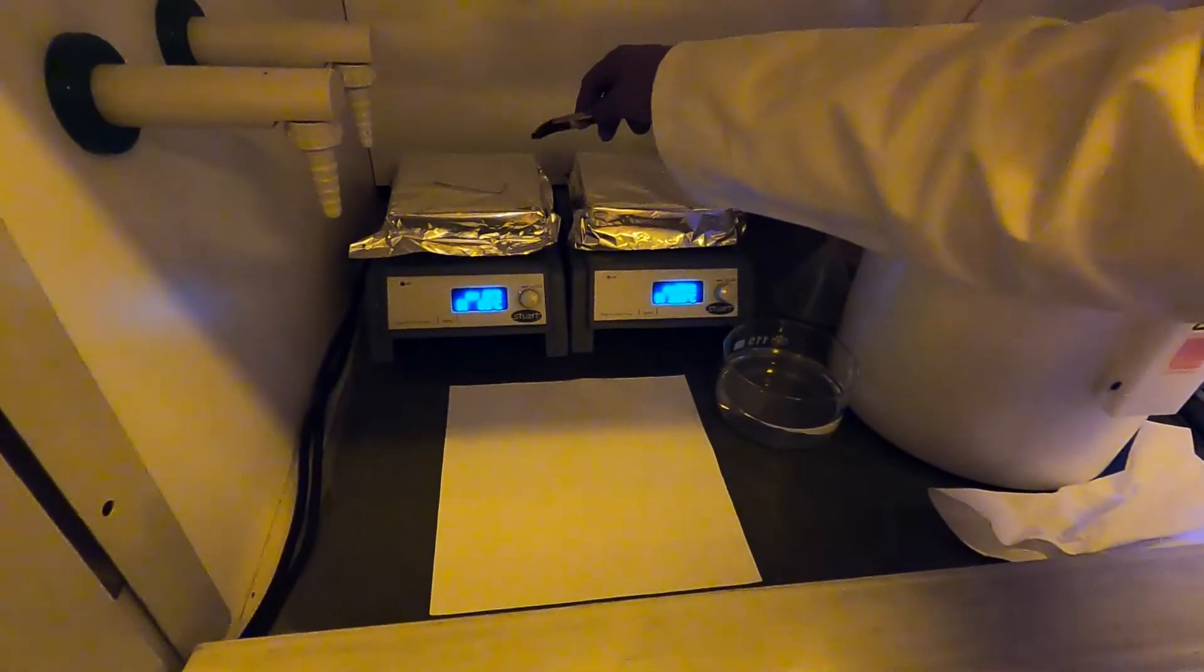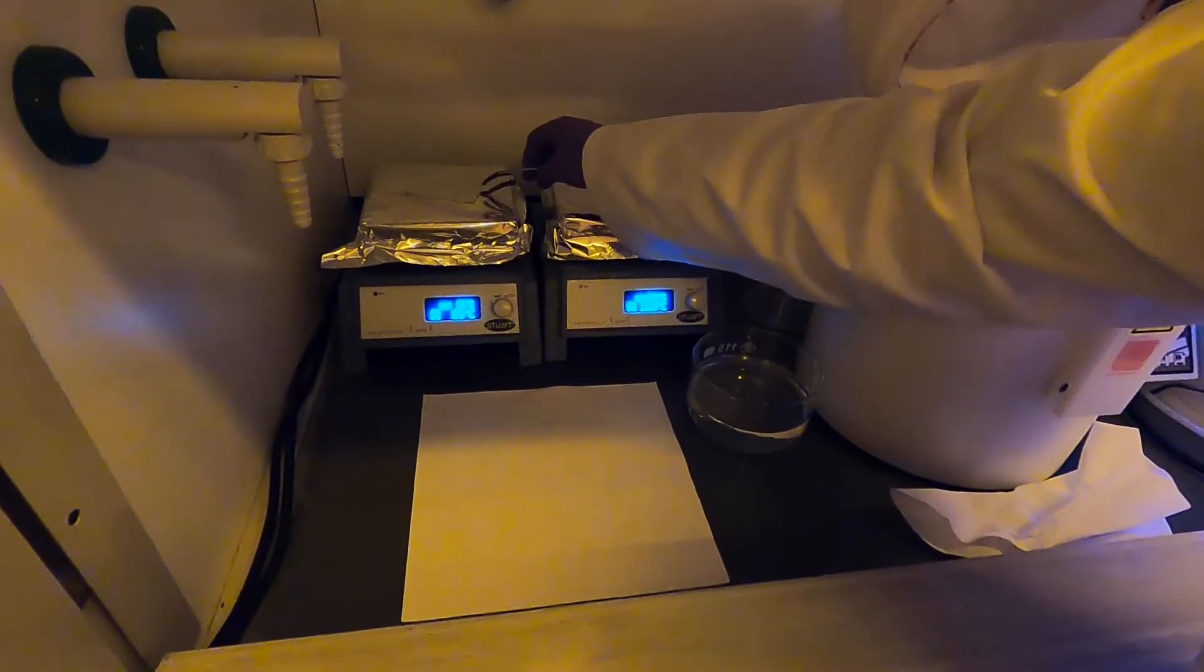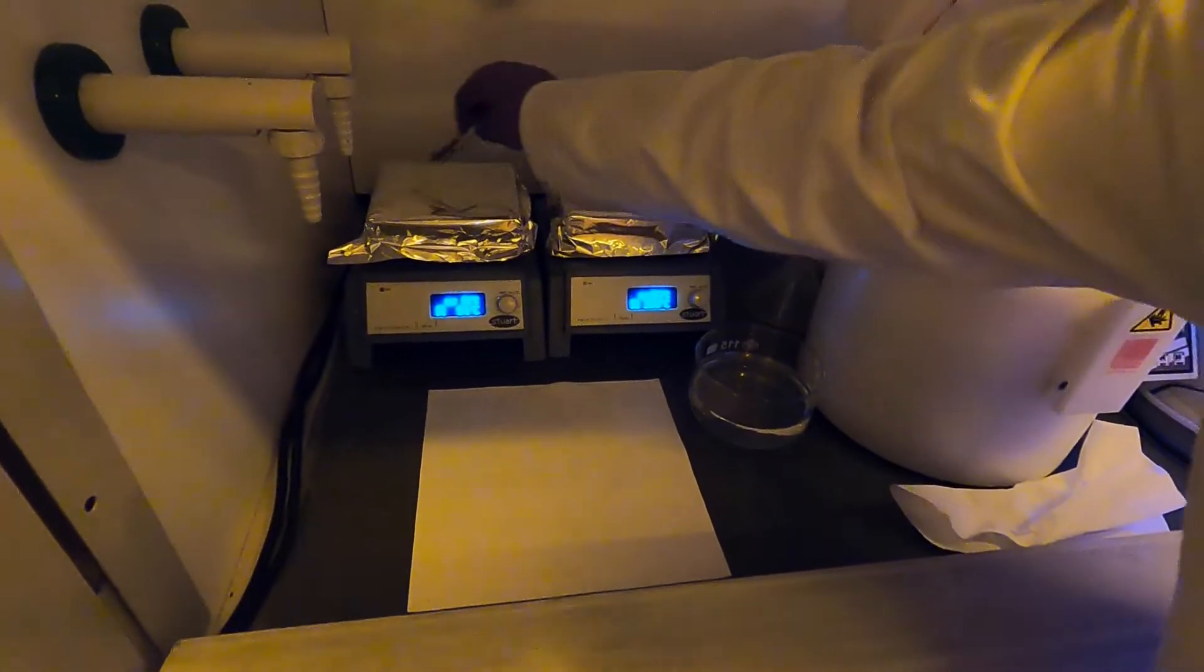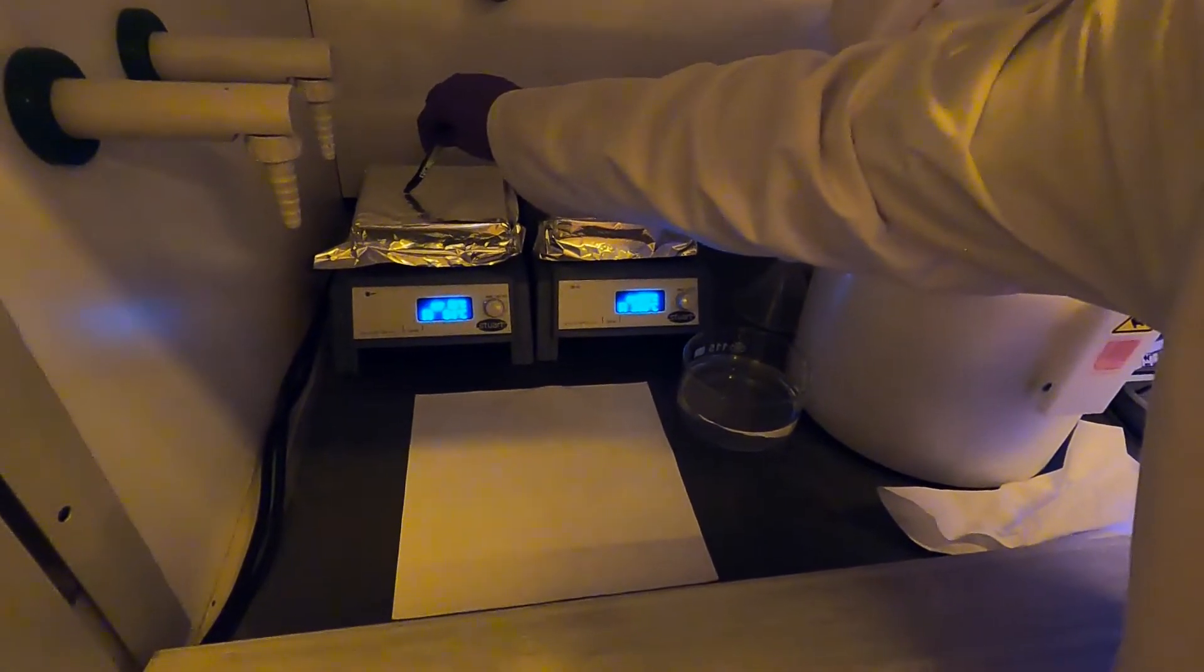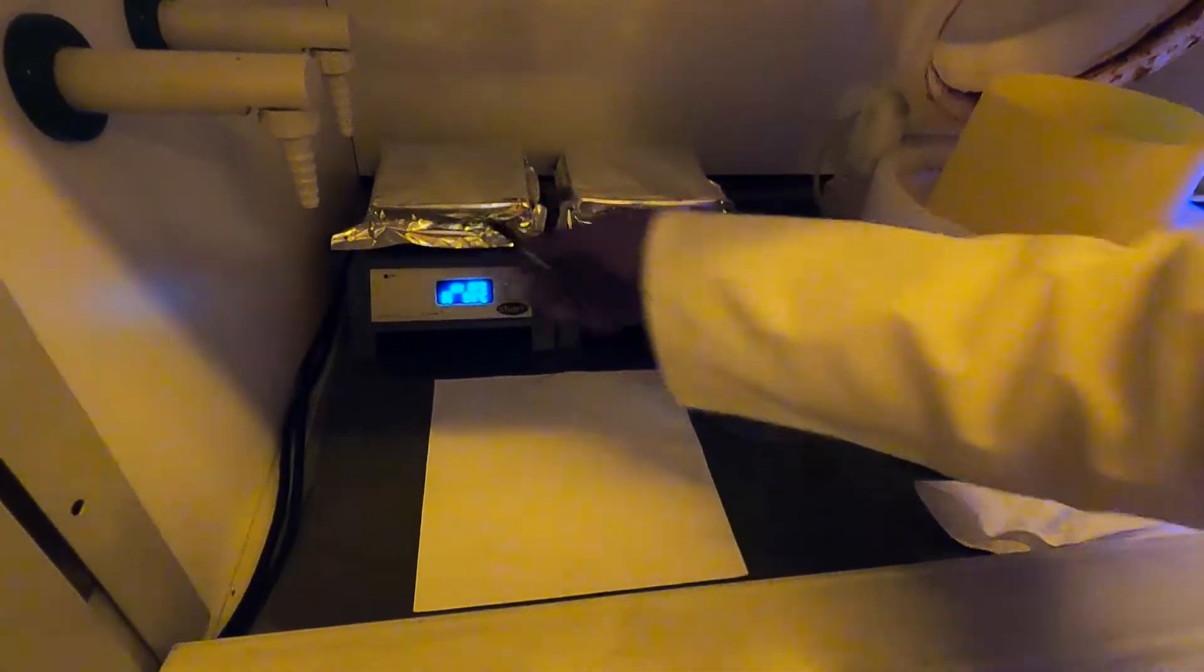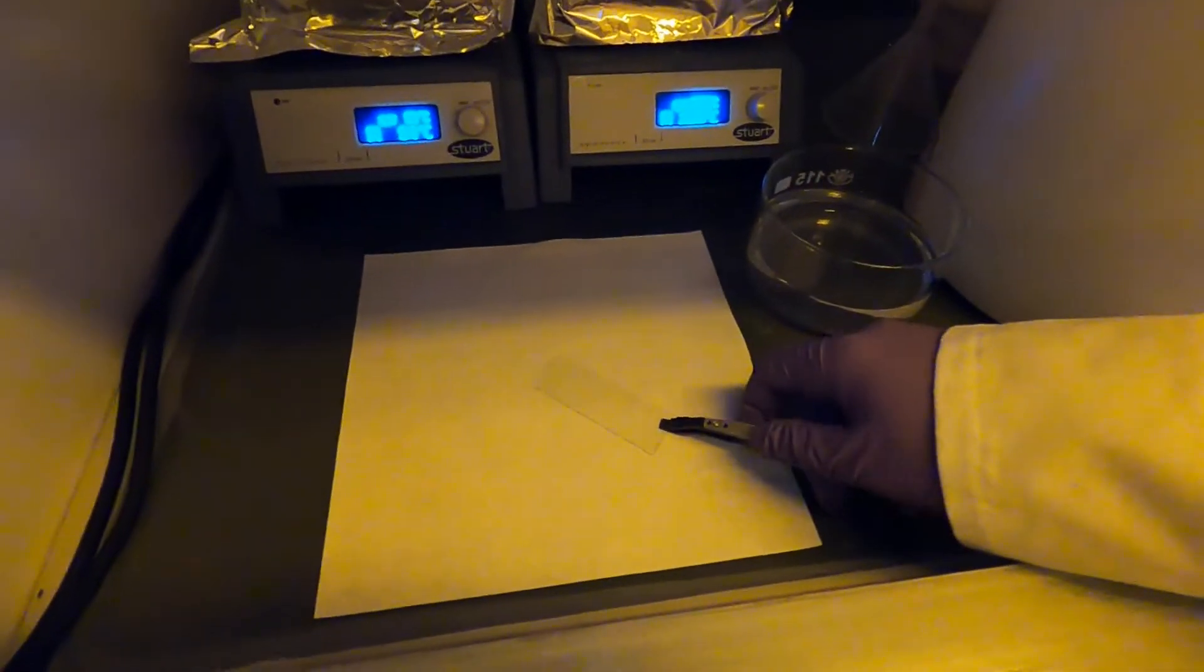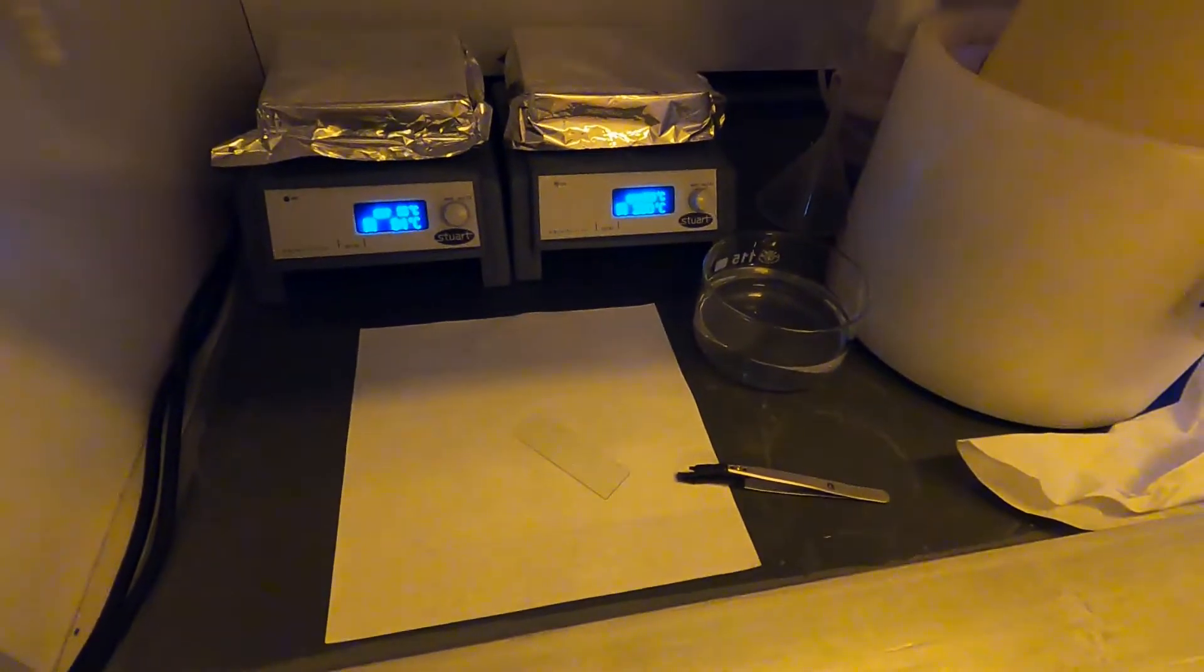I will now take off the sample to cool it down. It will get a little bit sticky now because there will inevitably be some SU-8 on the bottom surface, so you want to just prod it to the edge of the hot plate, pick it up and leave it to cool down on a clean piece of paper for about one minute.